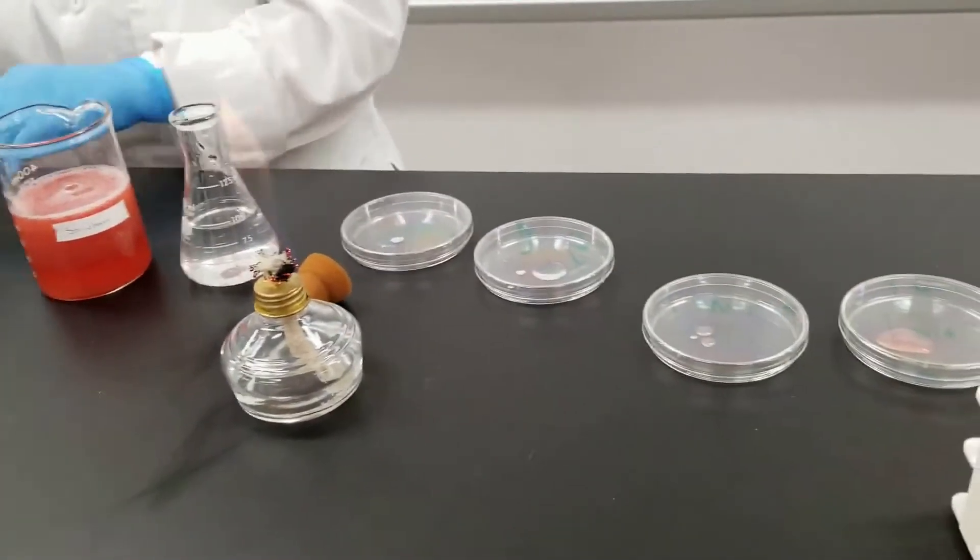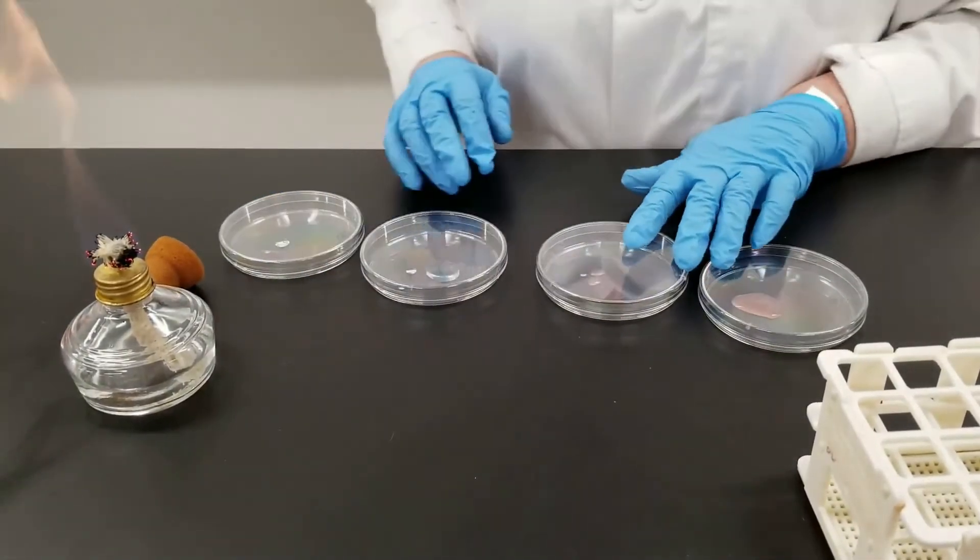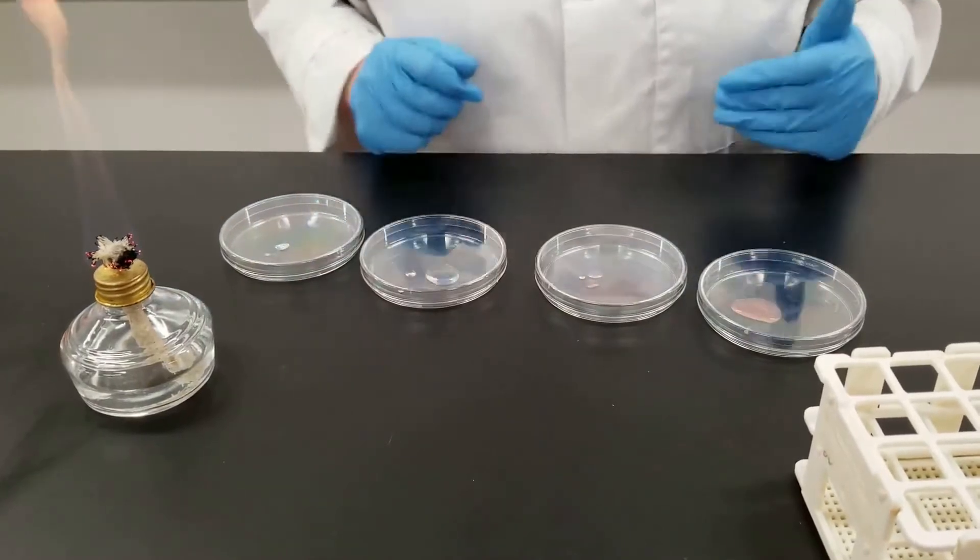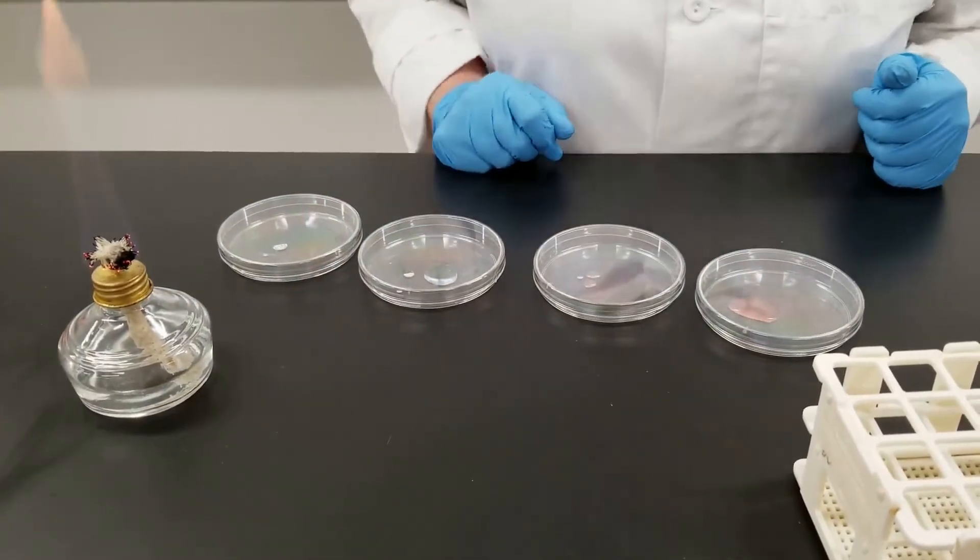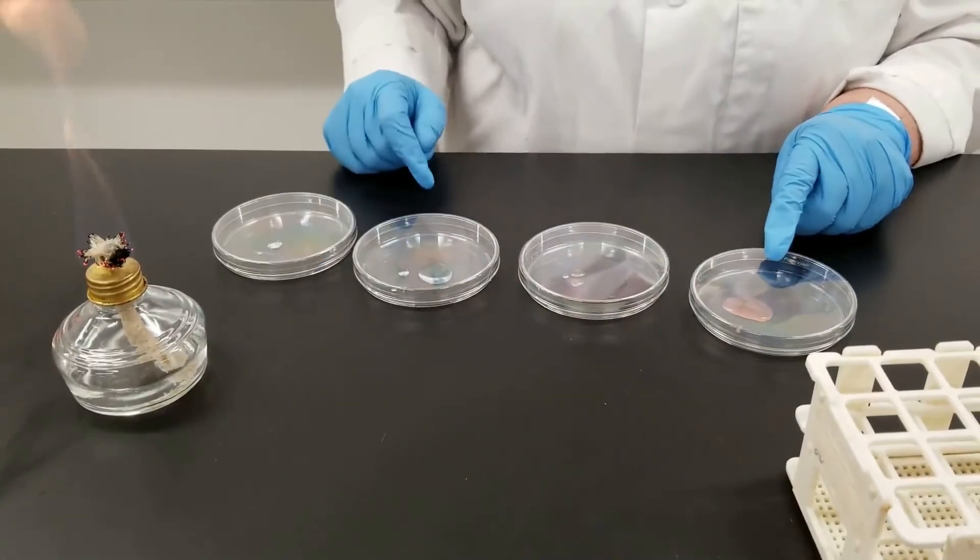And hopefully be hitting it in the right area to determine, once again, how many bacteria per gram of strawberries was this. And you can tell just by looking at the color, you can see that it's been diluted out.